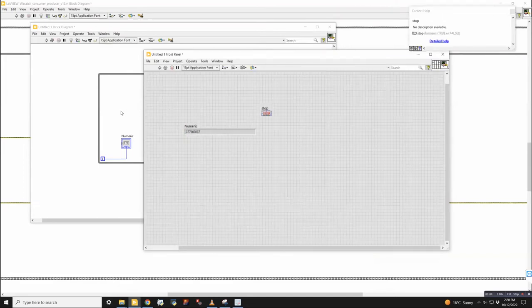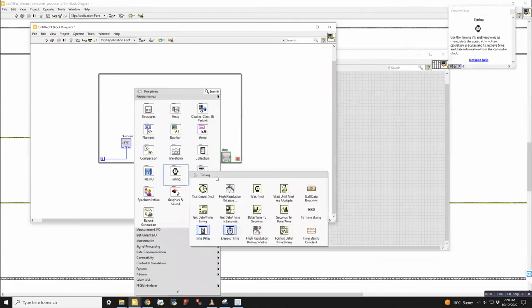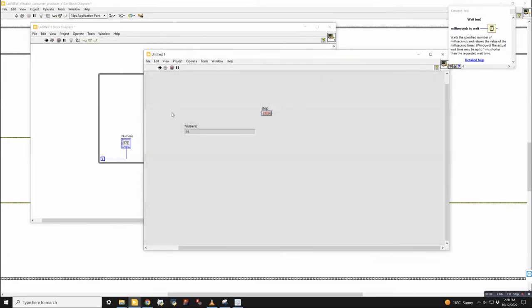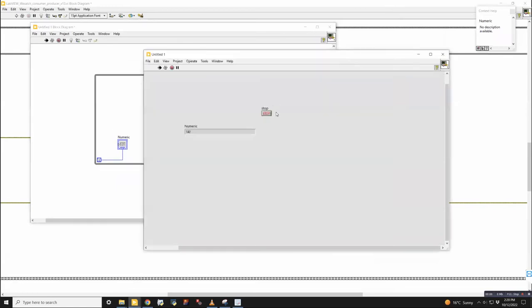Exactly. So all you need to do is go under timing, and then go to wait. And then I can change this to a constant. So let's say I make this 100 milliseconds. Then this will update at a rate of 10 per second. Okay, nice. Which is fast, but depending on what you want to do, this may be too slow. So you need to be careful about the actual value that you put in here.